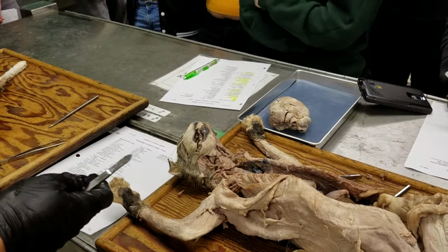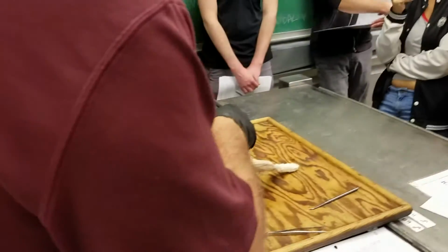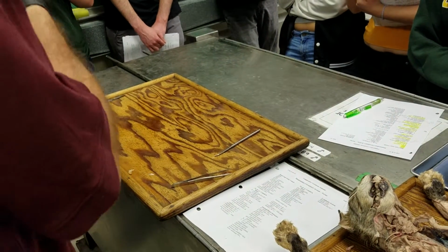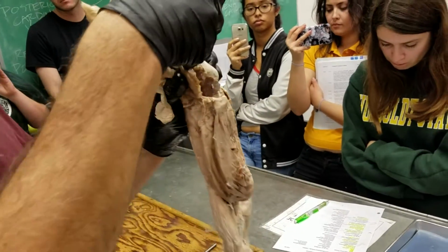Okay, let's come back then to the arterial system. I think it's actually easier on the right. Coming out of the heart, we have then the aorta, and there's a first branch off the aorta here, and that's the brachiocephalic artery, also called the brachiocephalic trunk. Okay, that's this thing here.